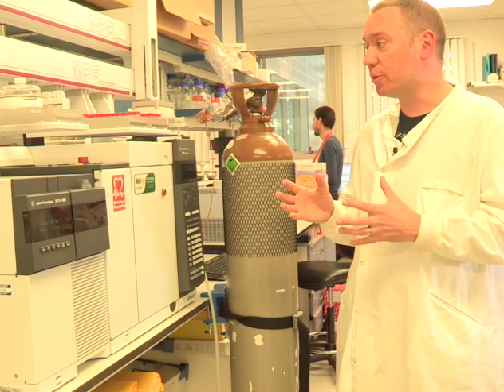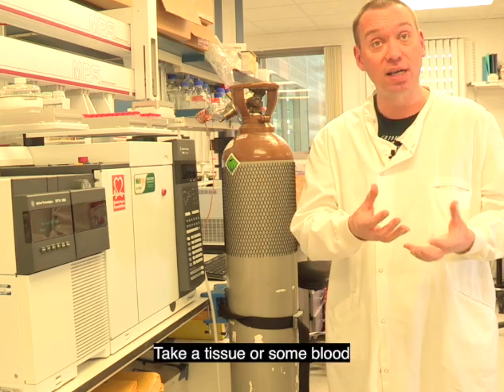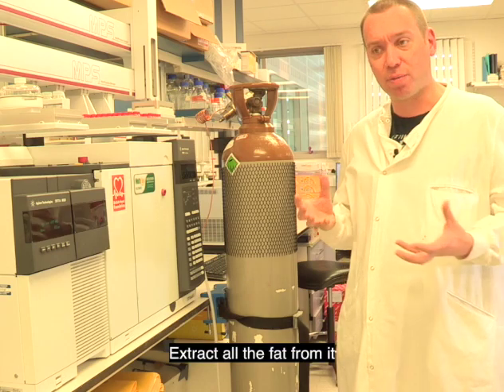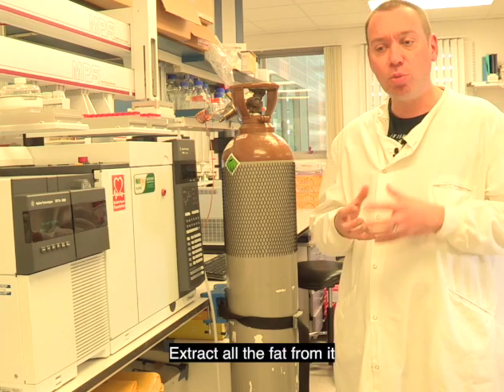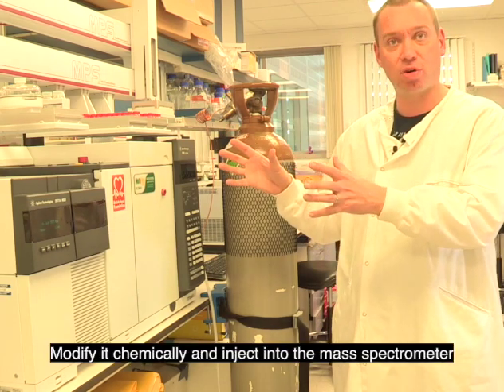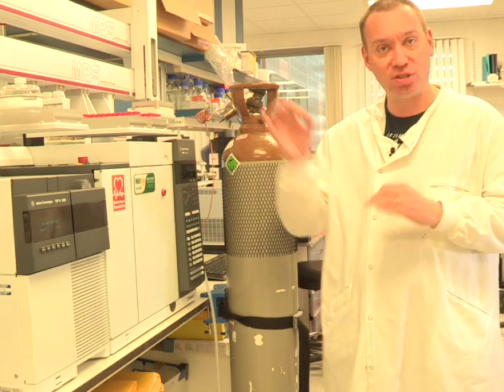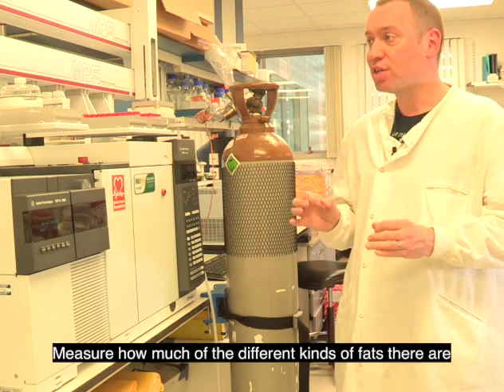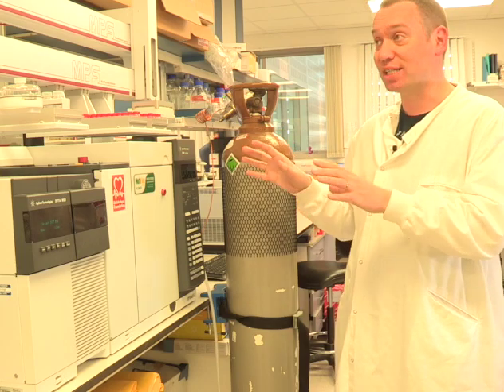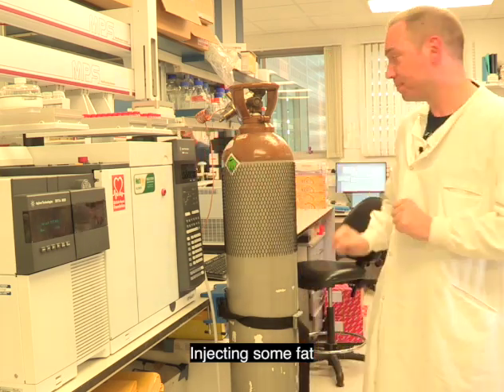In order to do it, we take a tissue or some blood that we're interested in measuring, extract all the fat from it, modify it chemically, and inject it into our mass spectrometer — which then measures how much of the different kinds of fats we have. I'm going to show you the mass spectrometer in action now and show you it injecting some fat.